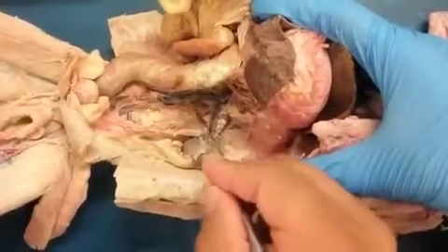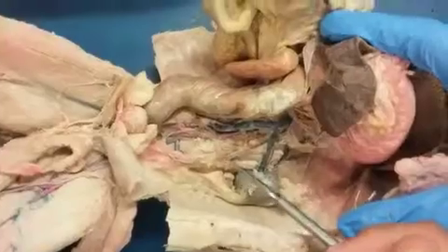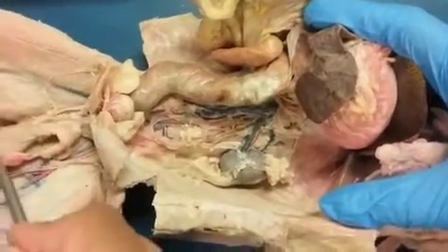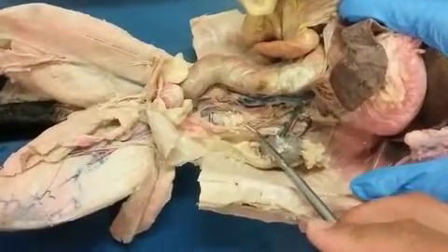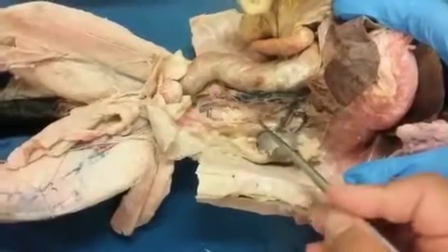Right? Continuing down from there, you guys have a male cat, so then you would see your gonadal artery and vein. You can get a good sense of the artery here. Right? And of course, that's going to exit here and make its way down to the testes. So that one is a little bit hard to see here, but there it is. Right? Coming off of that abdominal aorta.